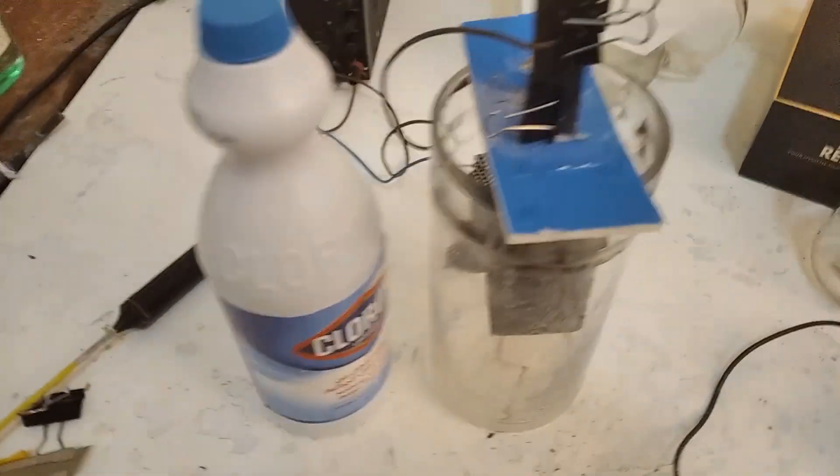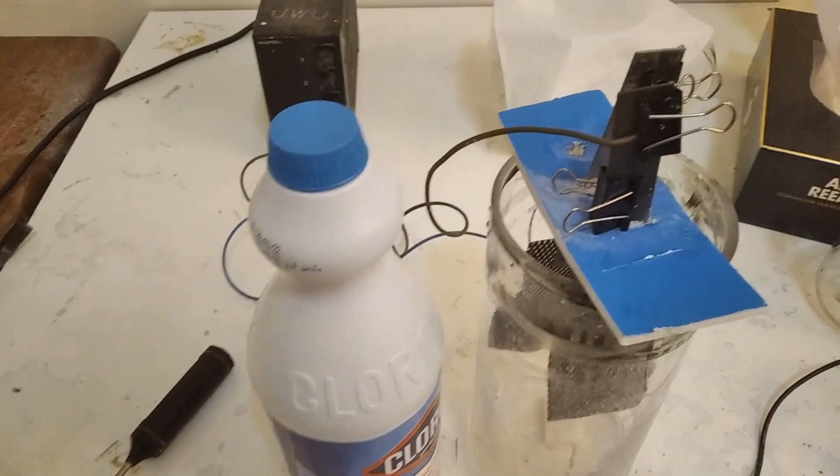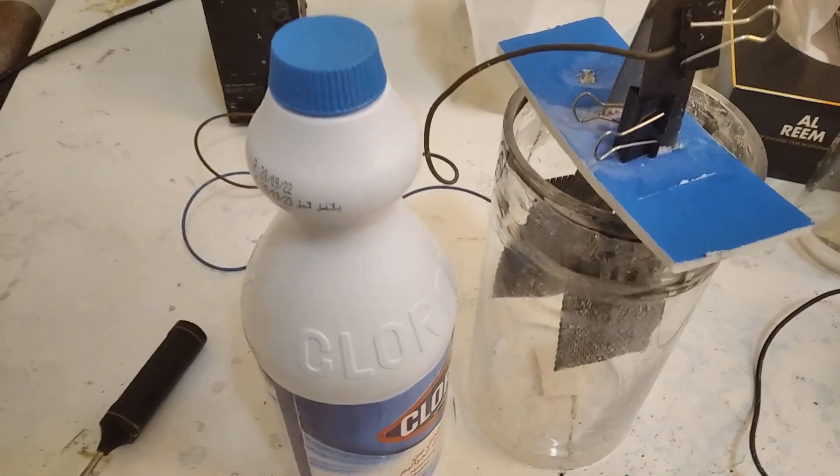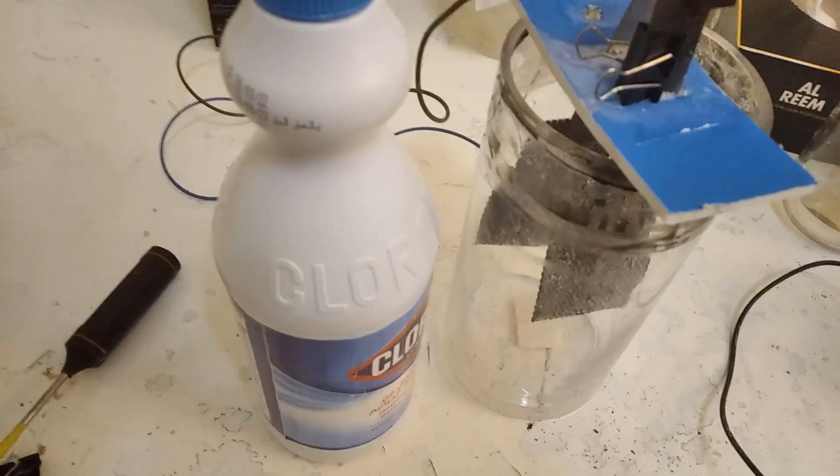This is Beerus's voice and today I'm going to confirm or deny the theory known as the hypochlorite oxidation theory, where we're oxidizing hypochlorite with a lead dioxide electrode which should prevent chloride-mediated erosion, in theory at least.